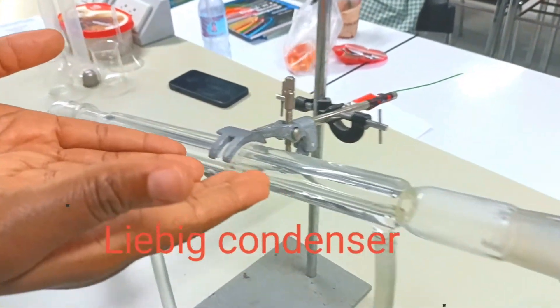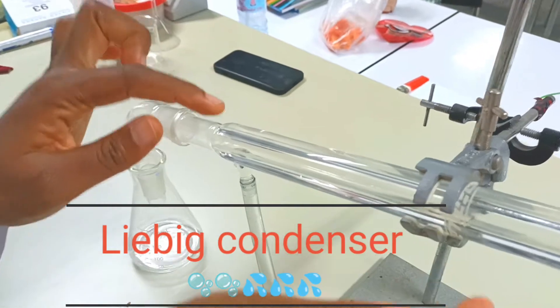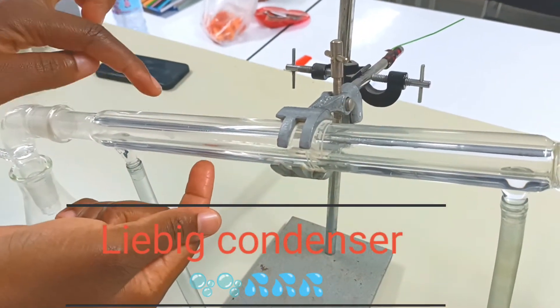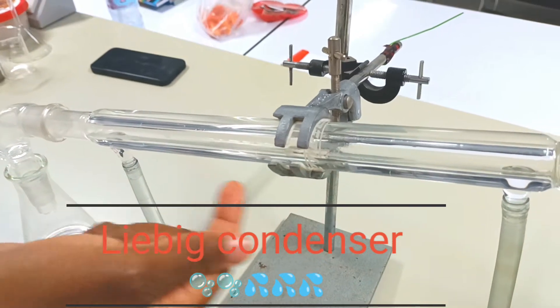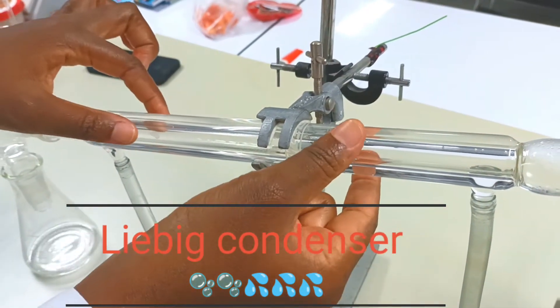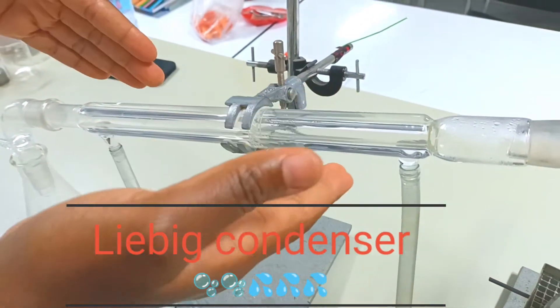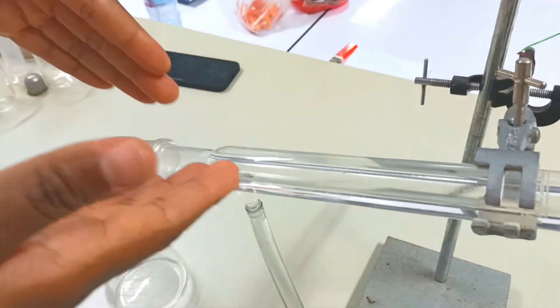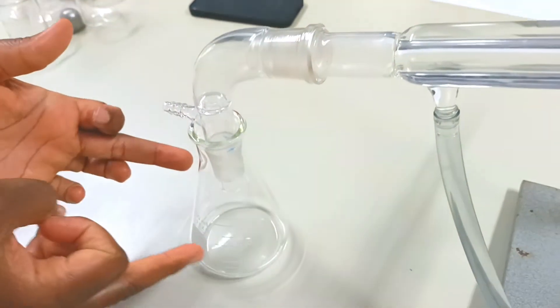This is the condenser. In this condenser, there are two tubes. The smaller tube inside contains the gas, while the tube outside has water to cool. This gas will be converted back to liquid and collected here.